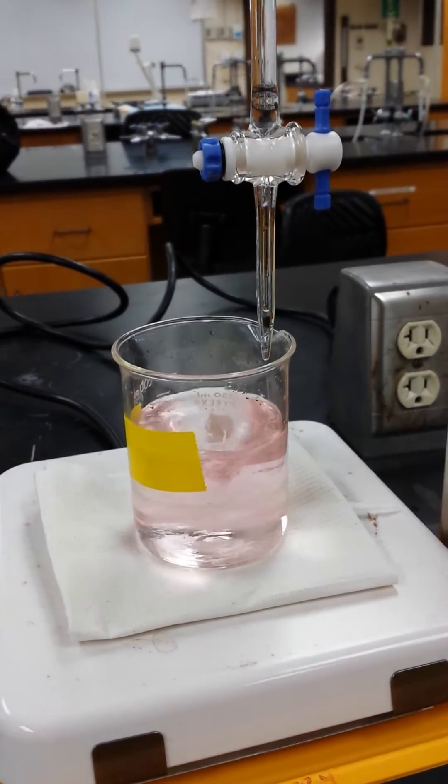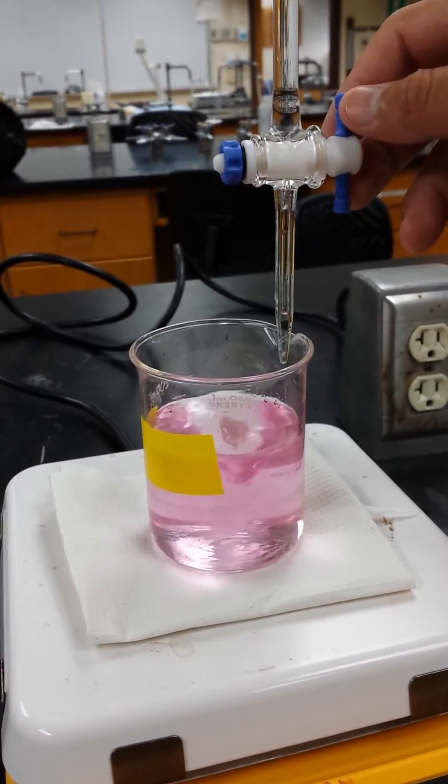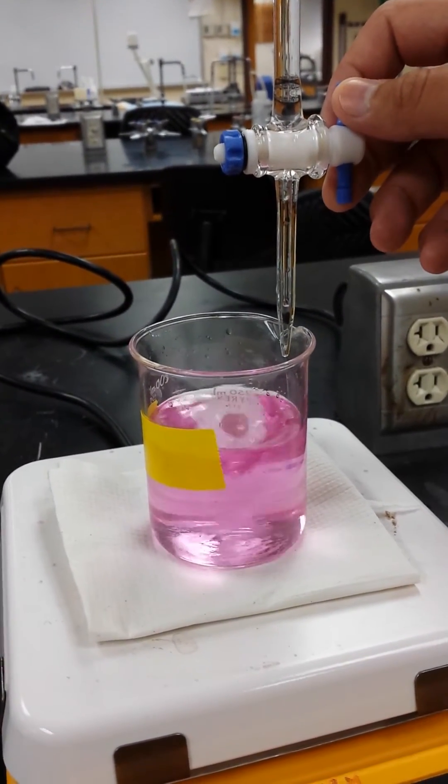Oh, but the hot plate... What? Are you going to pick the hot plate too? That's super dark pink enough. Perfect.